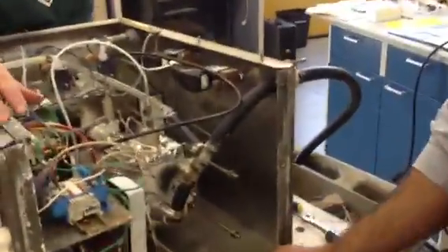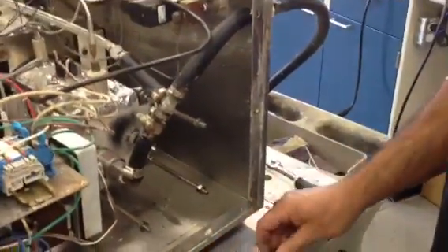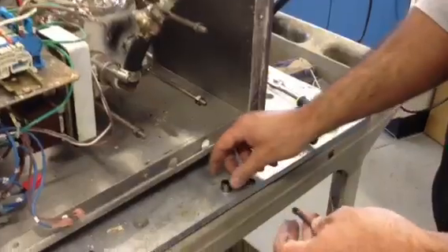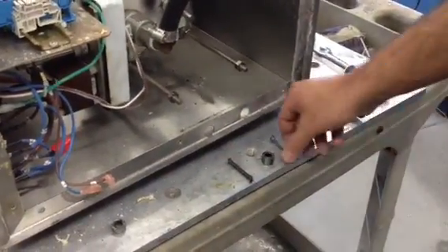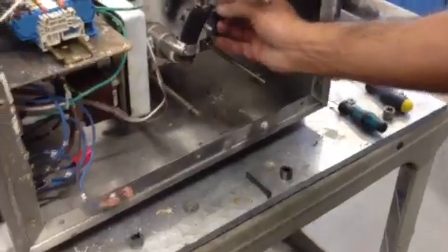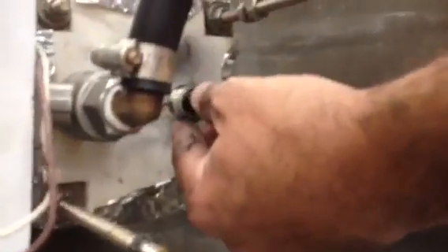Again, the old parts that we removed, there's three new components that we're going to put in. The agitator rope, you have a graphite cylinder, and the agitator rope again. We're going to start with the first rope. And basically you want to start by sliding one end in, and then you'll slowly wrap it around, and you want to keep sliding the rope up inside the nipple as you go.